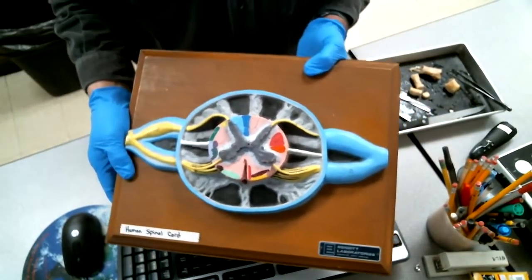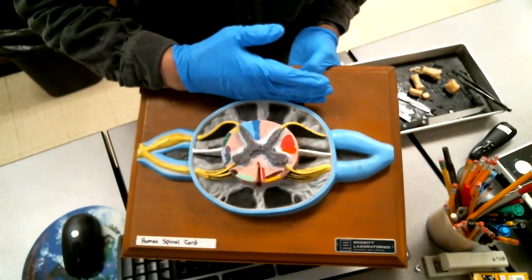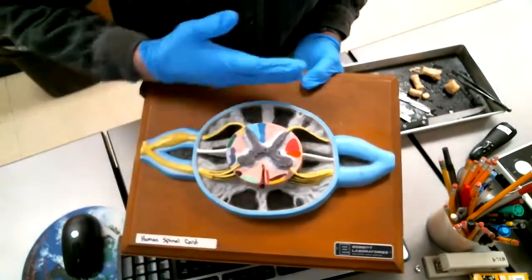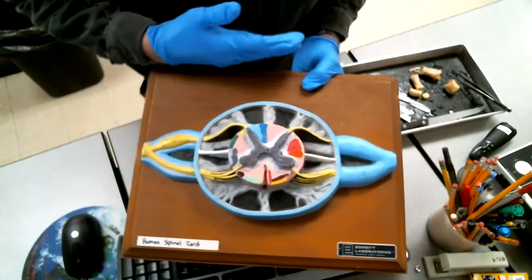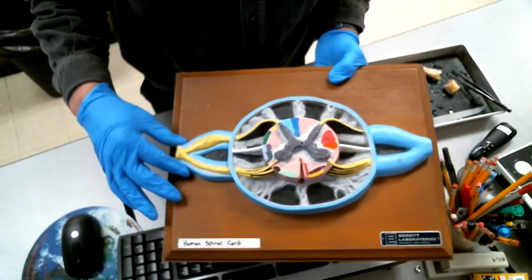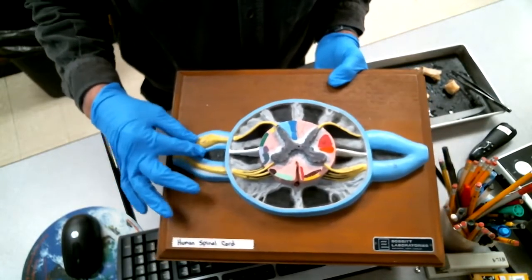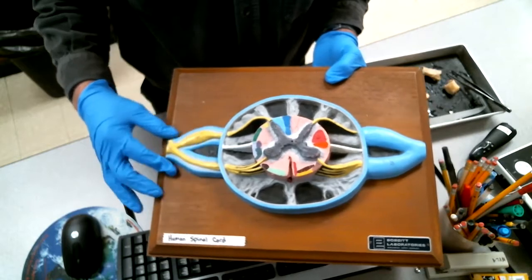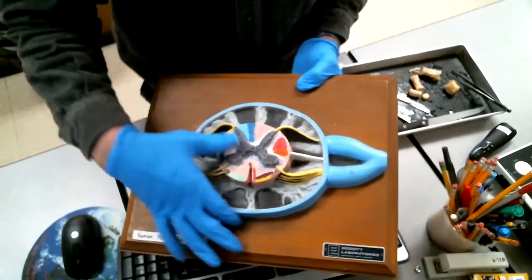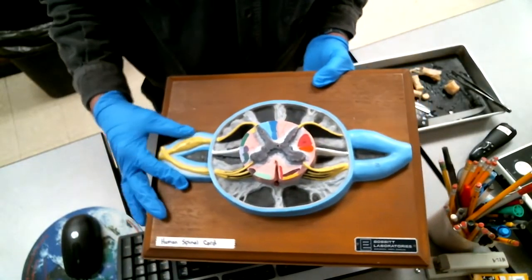This is much enlarged of the spinal cord. This is the dorsal region. This is the ventral region. In the humans, this would be anterior, posterior. In the cow, it's ventral and dorsal. This is the root of the spinal nerve coming together, the dorsal root, the ventral root. The dorsal root has a ganglion in it, and then this would come out of the vertebrae right there. Here, this blue is the meninges, and this is the epineurium kind of surrounding the nerve.